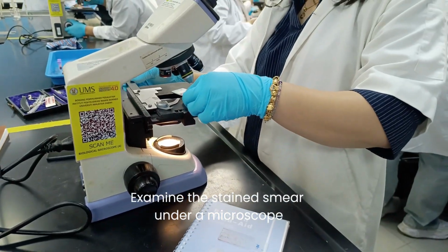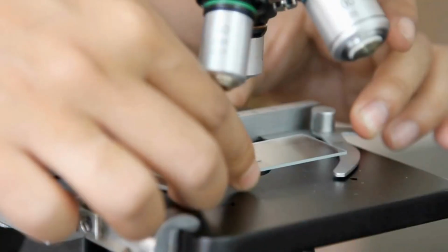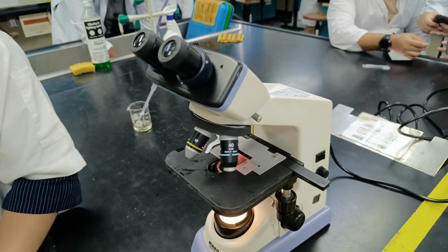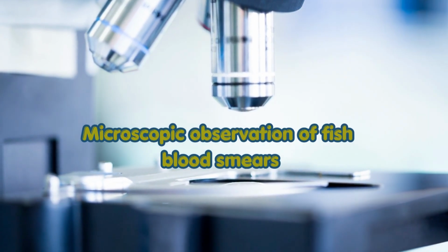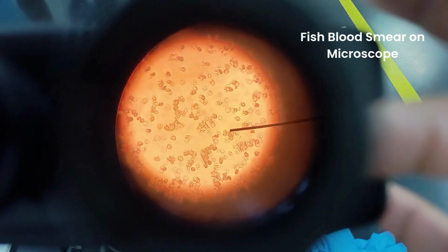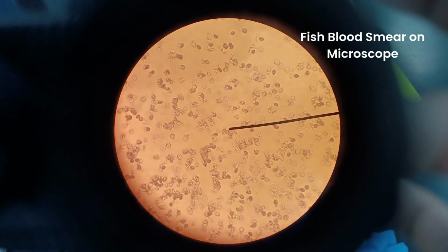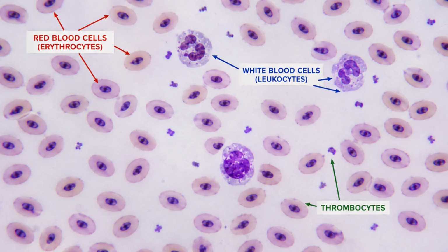Examine the stained smear under a microscope at various magnifications to observe and identify the types of tilapia blood cells, specifically red blood cells and white blood cells, and record their characteristics. Microscopic observation of fish blood smears. Microscopic examination of the red tilapia blood smear revealed the presence of red blood cells (erythrocytes), white blood cells (leukocytes), and thrombocytes, with red blood cells being the most abundant cell type observed in the smear.